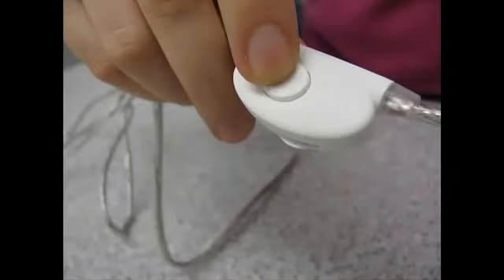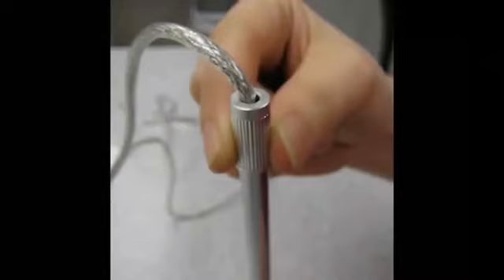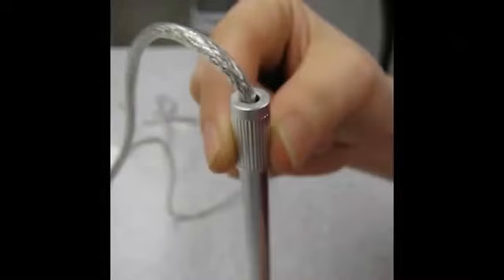You can also take a snapshot by clicking the white button on the camera cord. To make sure the snapshot is clear, use the focus wheel on the top of the microscope to bring the image into focus. Magnification is determined by the distance of the microscope to the object being viewed.